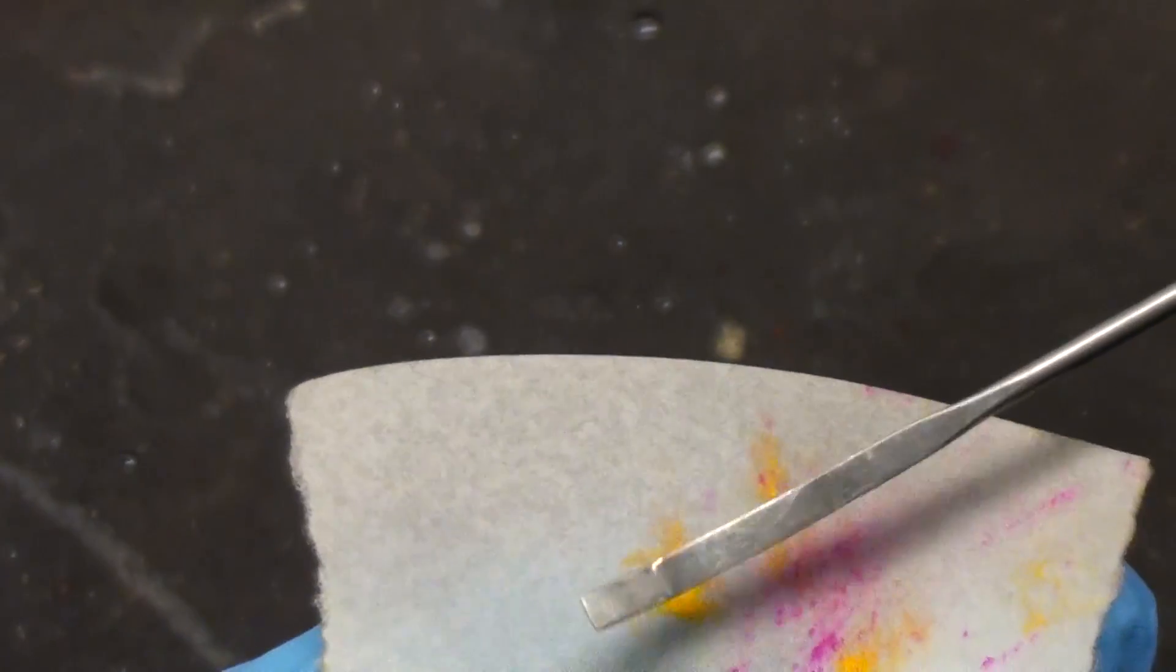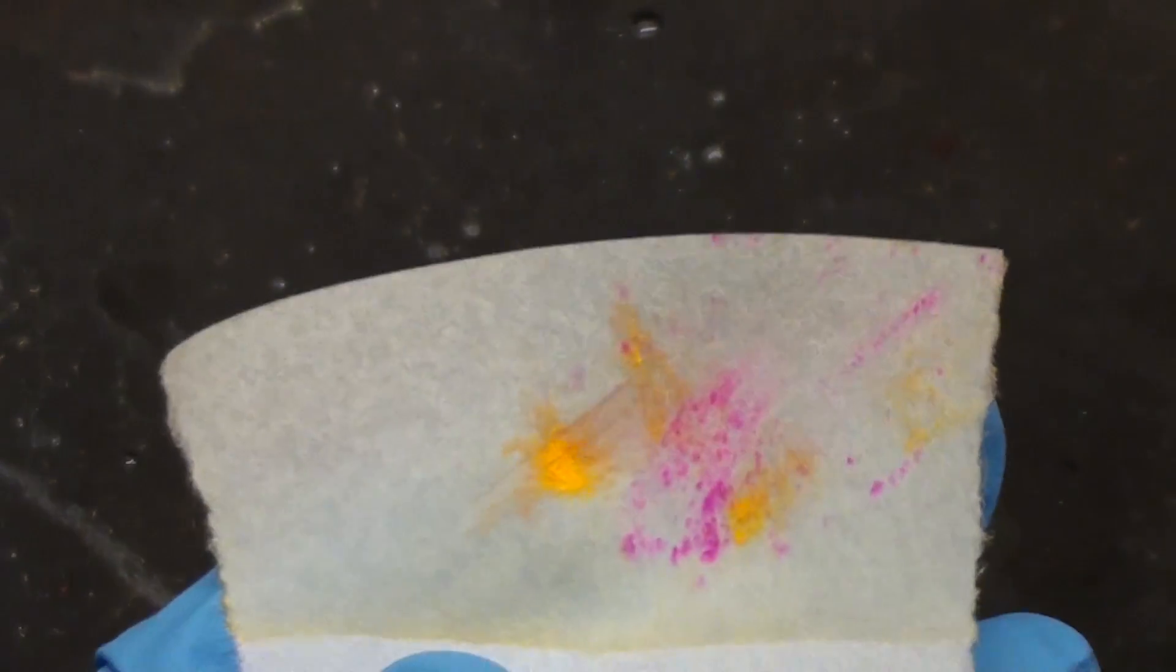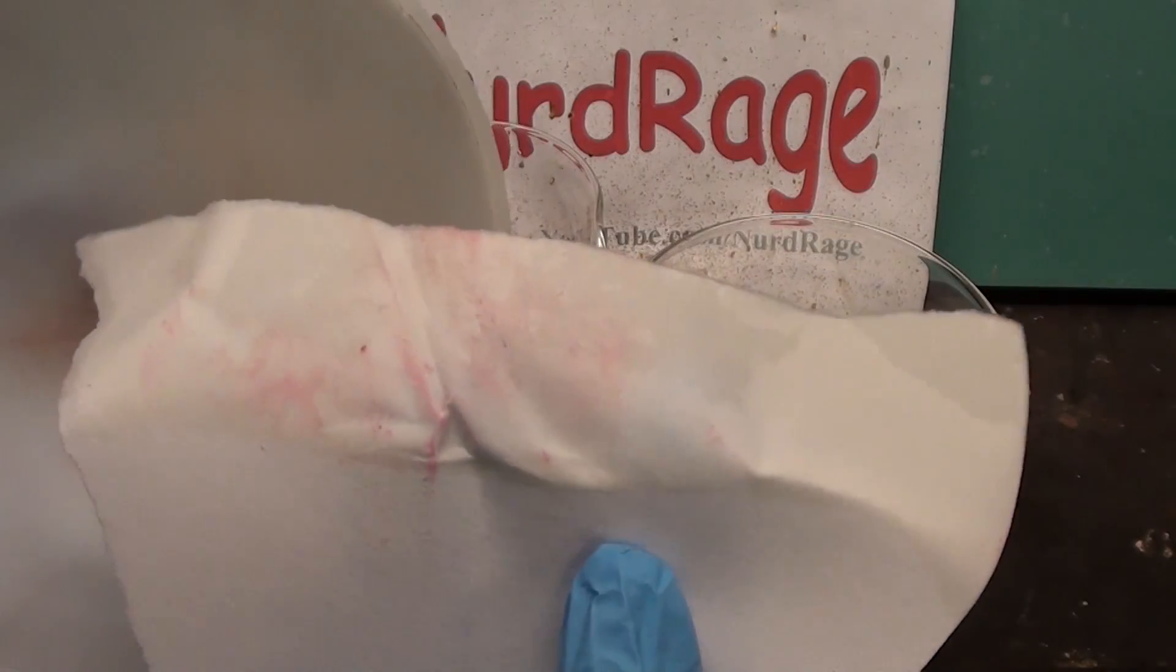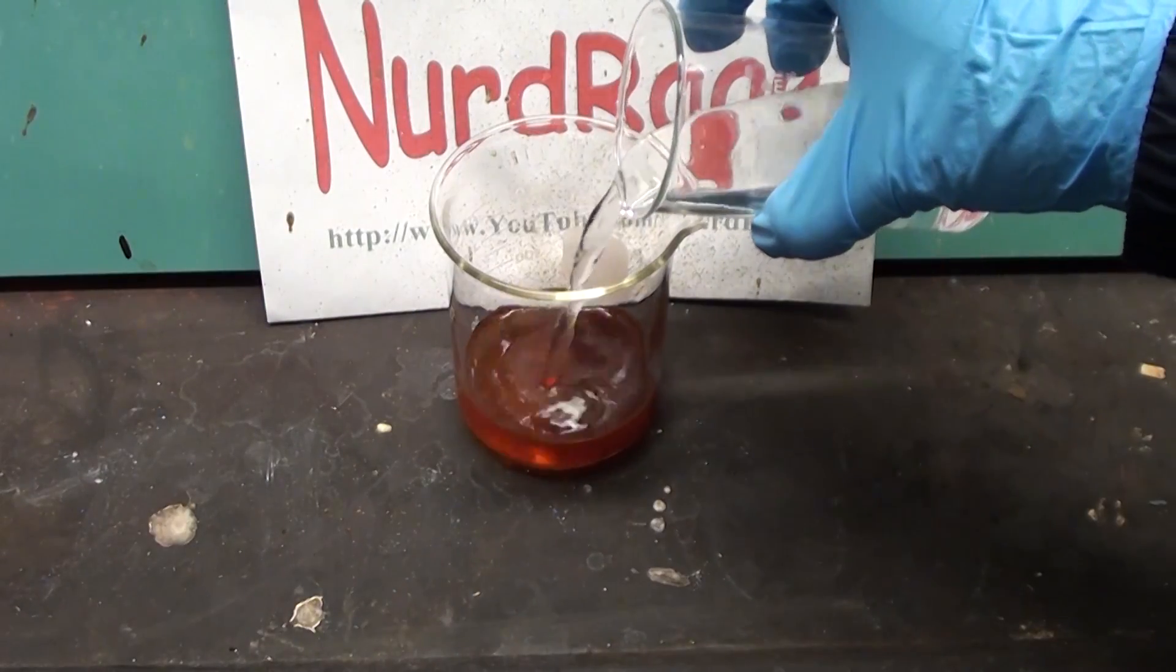If you're unsure about something and really need to know, then send a sample to a commercial analytical testing lab. Nonetheless for our purposes of testing soluble lead salts and metals in later videos, this solution will be enough.